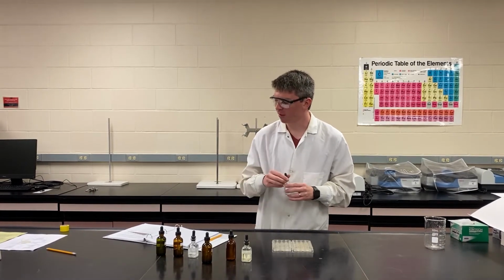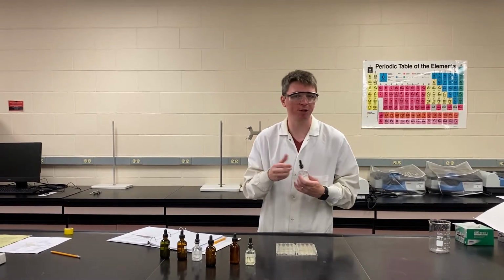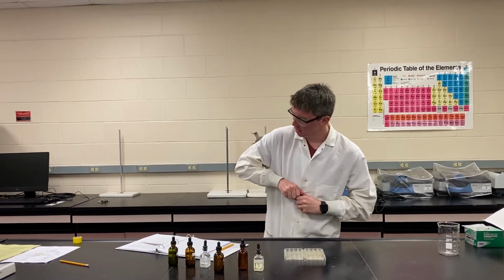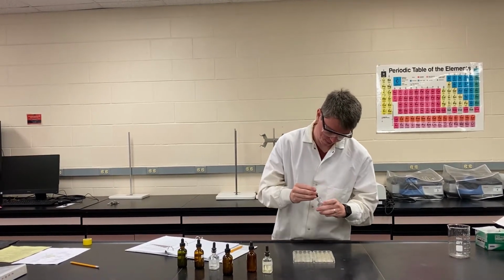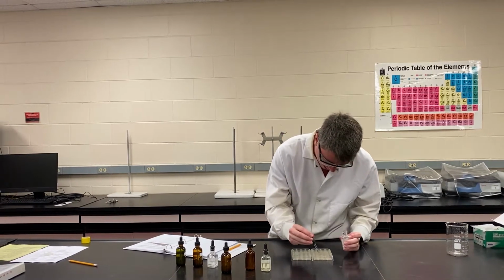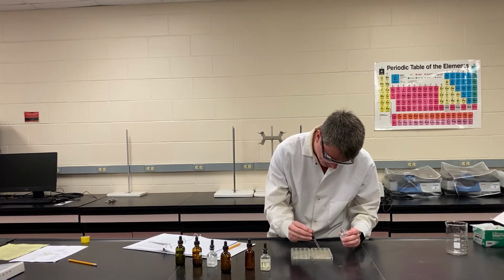We don't need to mix anything that has either already been mixed or is mixing with itself. So for example, if you look in the table, the first box is blocked out because it's mixing sodium hydroxide with sodium hydroxide. There's no reason to mix those because you won't get anything out of it. However, any of the rest of the boxes we will go ahead and fill in, and see those mixtures. So I'm going to go ahead and add sodium hydroxide across the top.